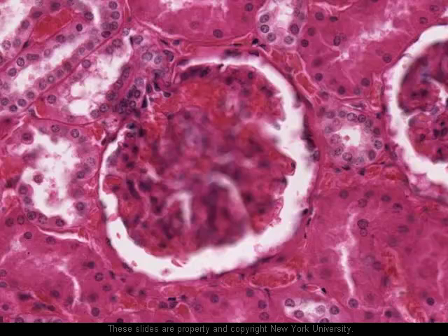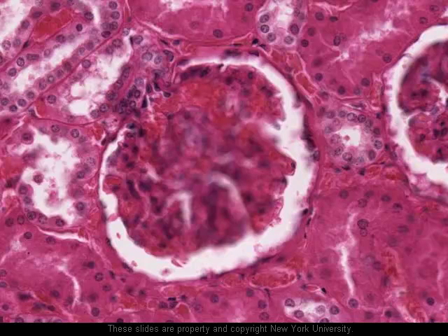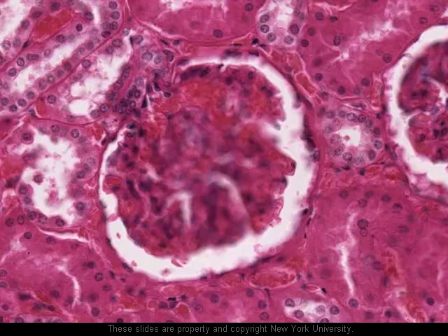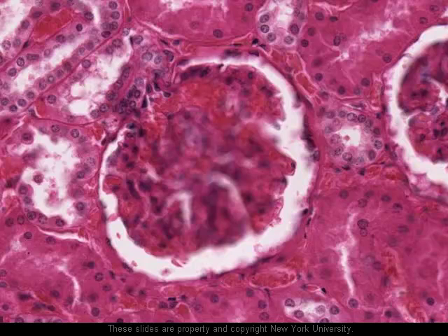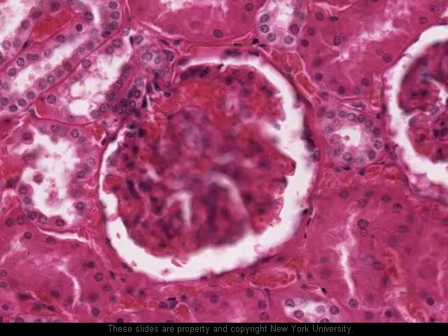So if we look, for example, at the tube represented by where I'm moving the pointer here, we can see the lumen appears to be collapsed and the cells have very indistinct borders between them. We can make out the nuclei — this is a simple cuboidal epithelium. This is proximal convoluted tubule. We can see a very thin red line which is the basement membrane. Here are the proximal convoluted tubule cells; here's the lumen, which doesn't look nice and clear, and this is because the apex of these cells has very long, very disorganized microvilli on them which increase the surface area available for absorption, which is the principal function of the proximal convoluted tubule. As a consequence of these long microvilli, the lumen is essentially obscured.